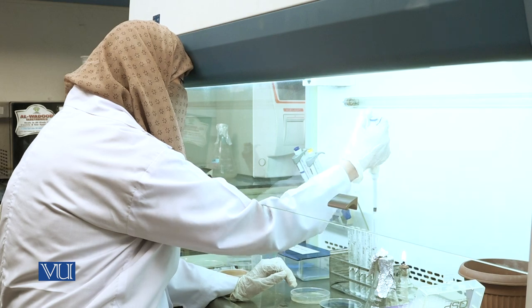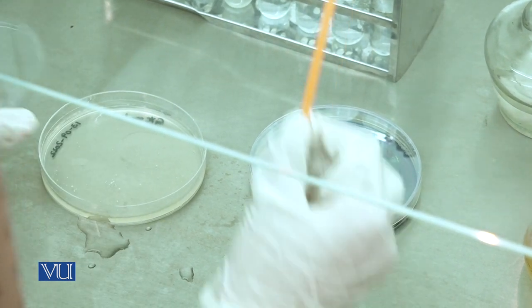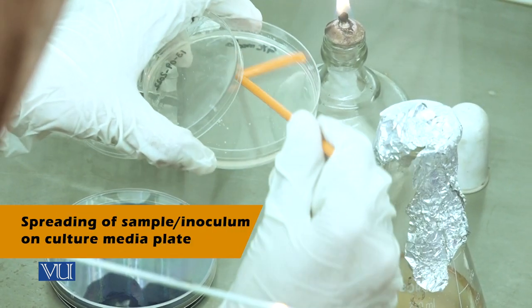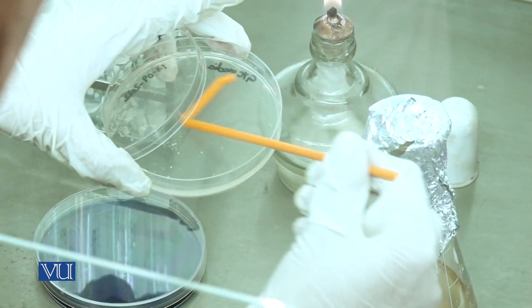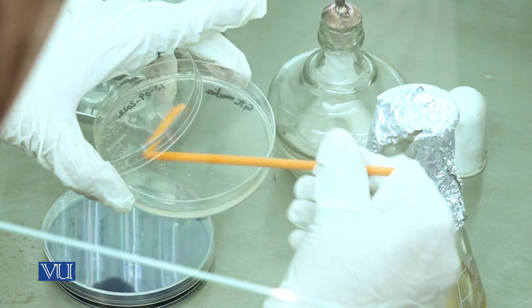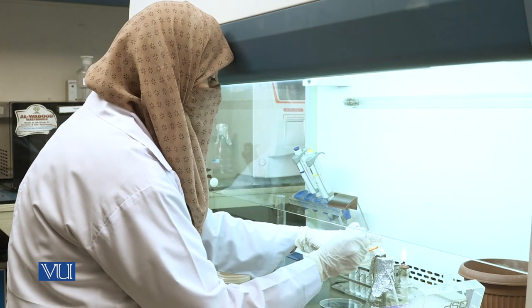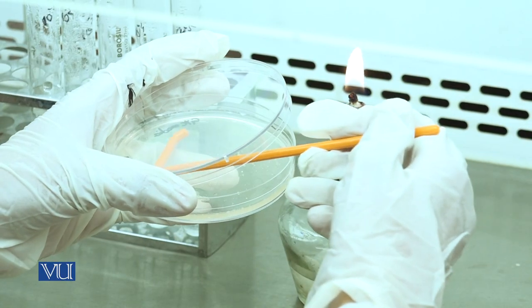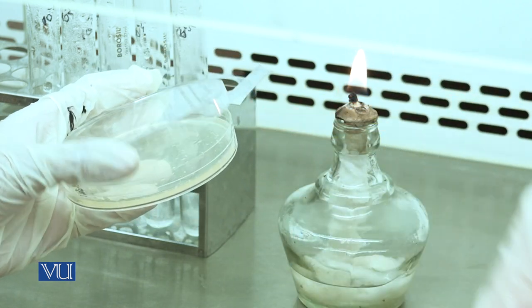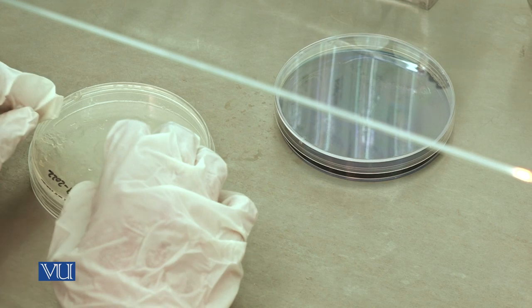Now inoculate the plate with grape sample from the 10 to the power of -5 dilution. For spreading, place the plate near the flame and spread the inoculum evenly throughout the surface of the agar. Evenly distribute the sample on the agar surface until the inoculum is fully absorbed. Place the plate in the incubator at 30 degrees centigrade for 7 days.